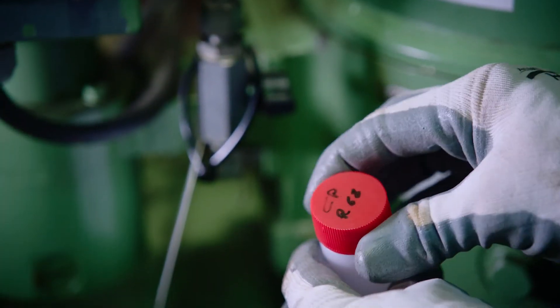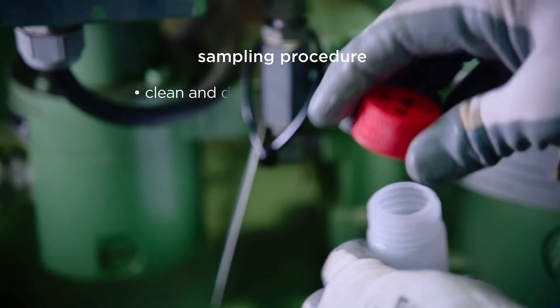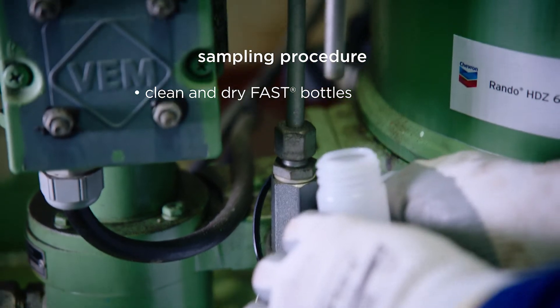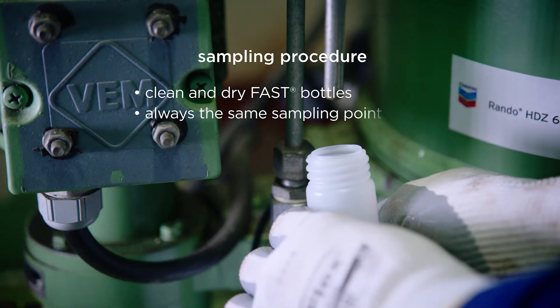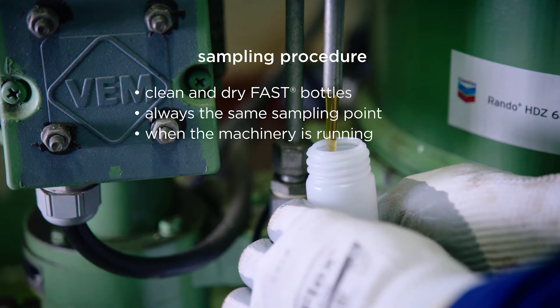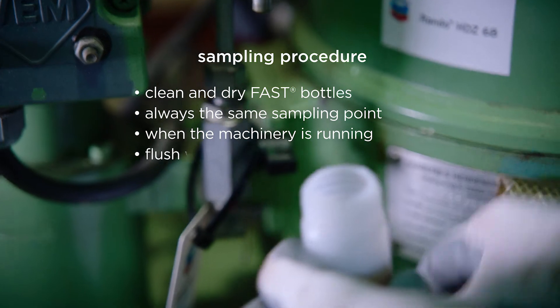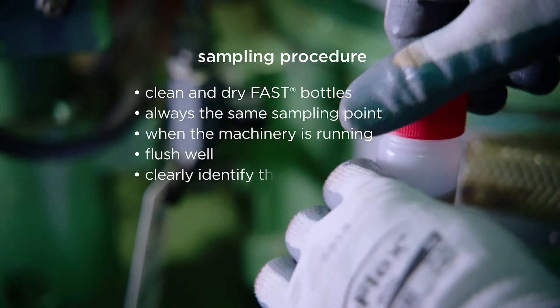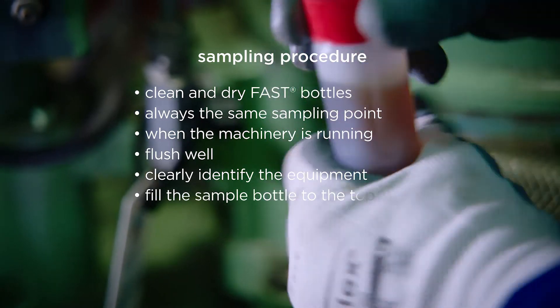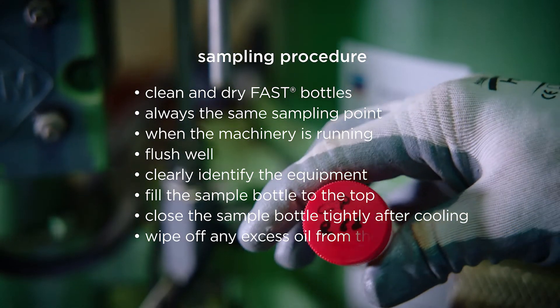For accurate results, exercise great care when taking each sample. Ensure that bottles are clean and dry and free from any contaminants. Always draw samples from the same sampling point and preferably when machinery is running and at operating temperature. Flush the oil sufficiently to allow the removal of any trapped water or debris. Fill the bottle to the top. After cooling, close the bottles tightly and wipe off any excess oil.